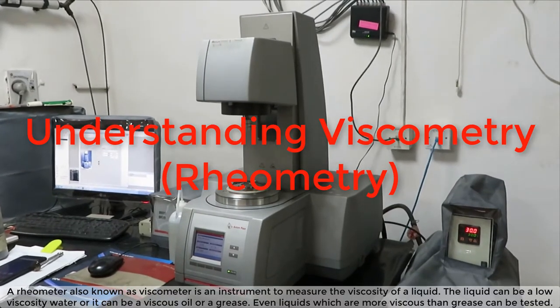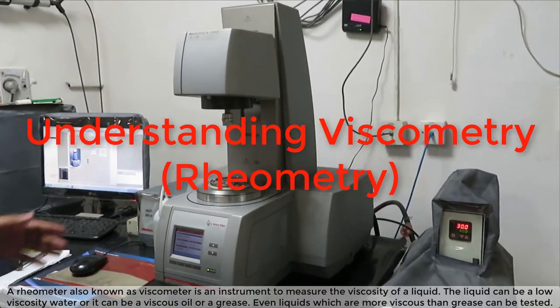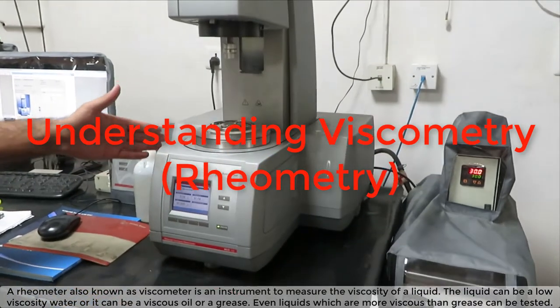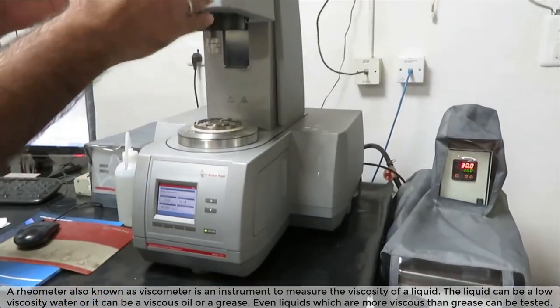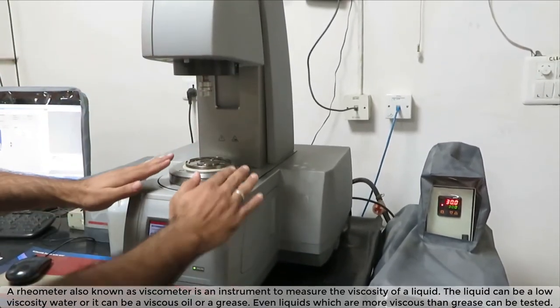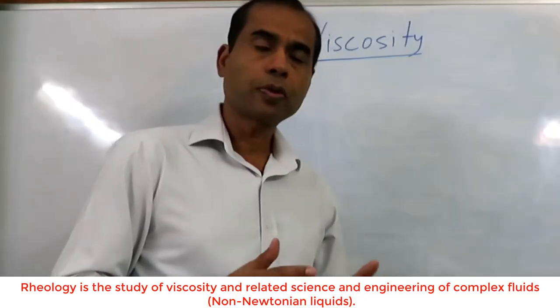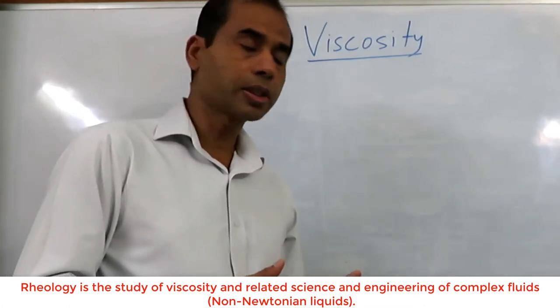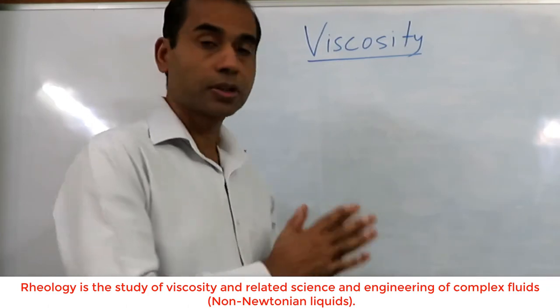A rheometer, also known as a viscometer, is an instrument to measure the viscosity of a liquid. The liquid can be a low viscosity water, a viscous oil, or a grease. Even liquids more viscous than grease can be tested. So before I talk about rheometry or rheology, let me define what viscosity is.